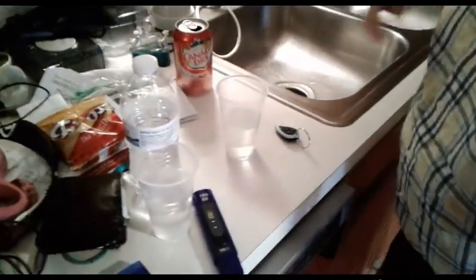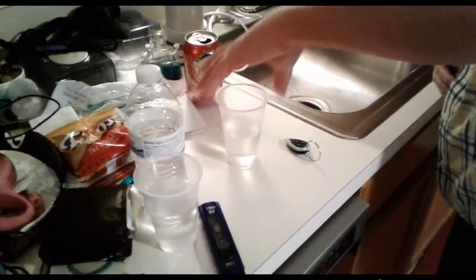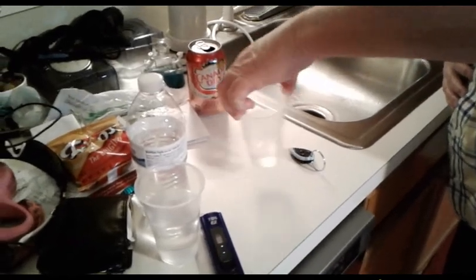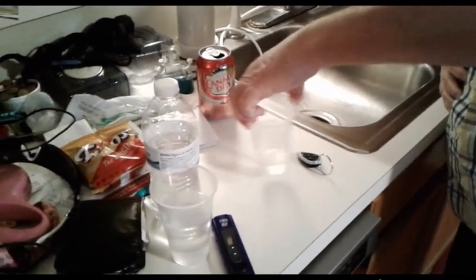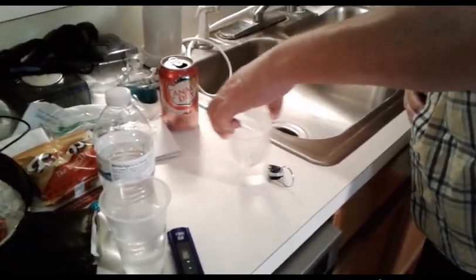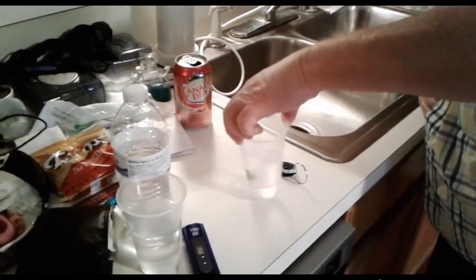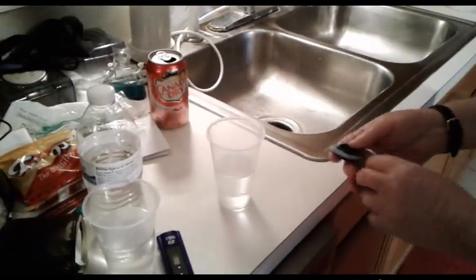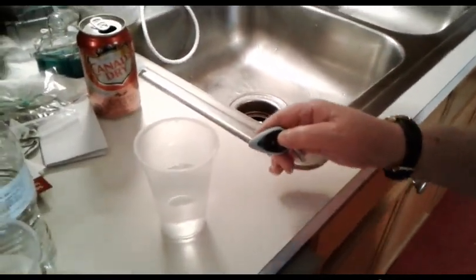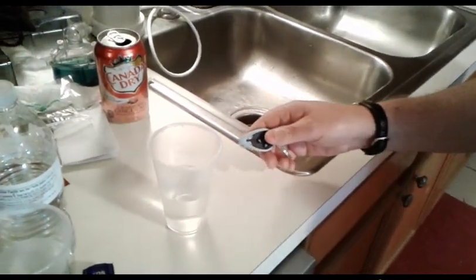So let's test this out now. I'm going to swirl it around — one, two, three, four, five, six, seven, eight, nine, ten. So what I'm going to do is press the light. Touch. That's blue. That's good.